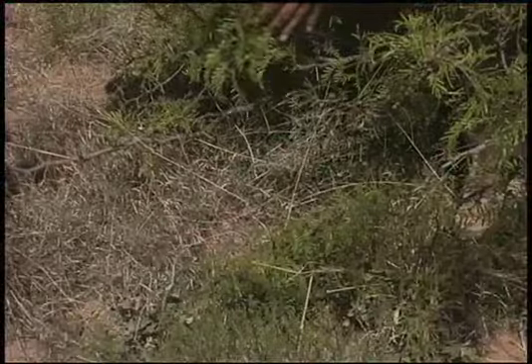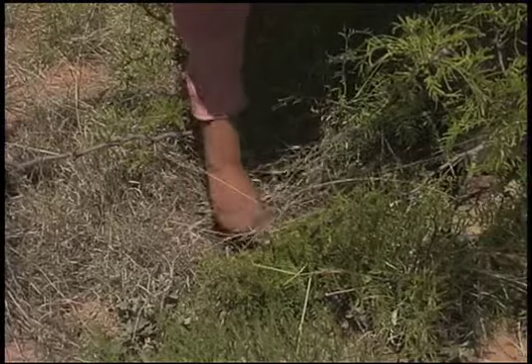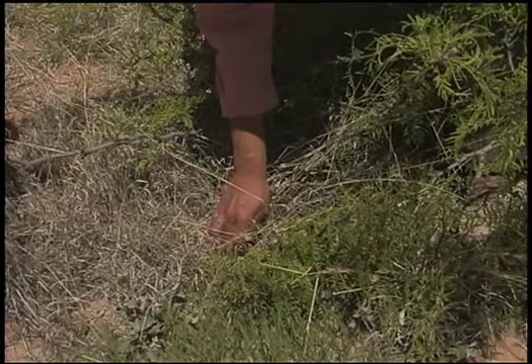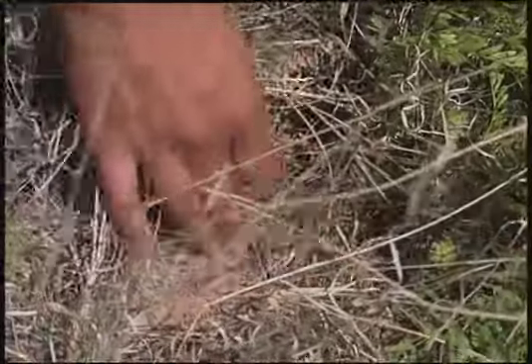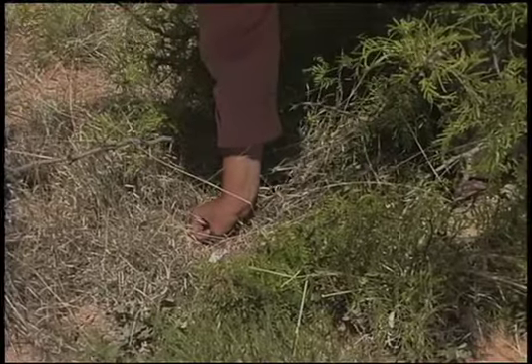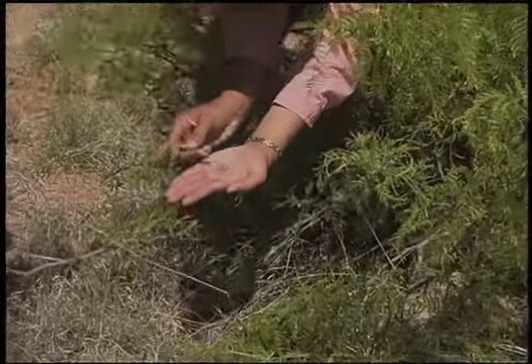If there's a case when there is shrub over grass canopy, record the stratum on the data sheet as a grass cover. If there's litter present on the surface, gently scrape it away so that none is included in the sample. If the sample flips, make sure you flip it back upright in your hand.